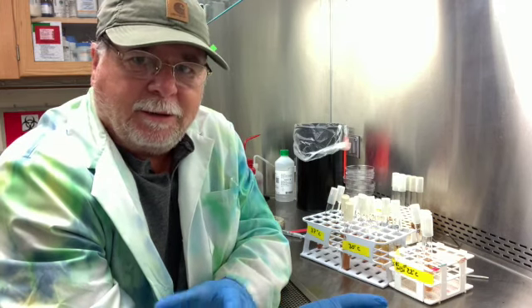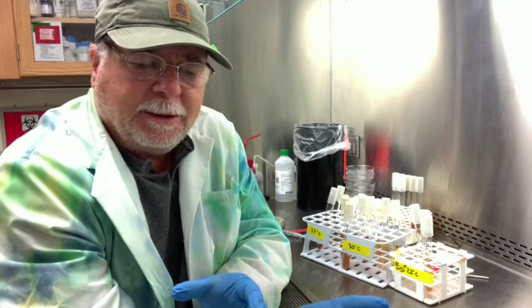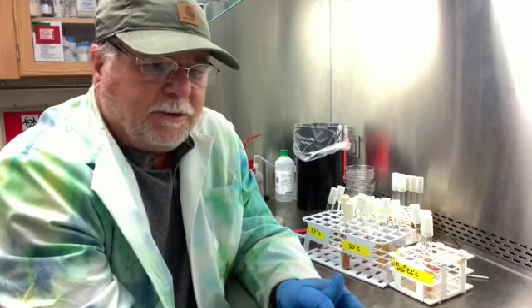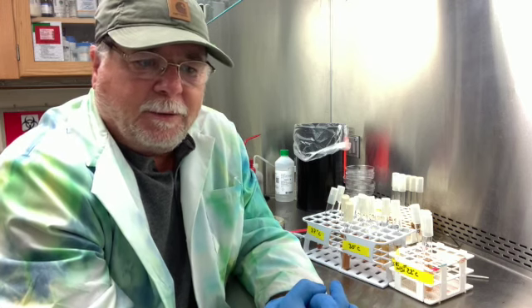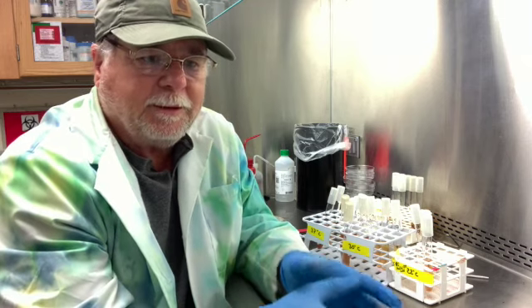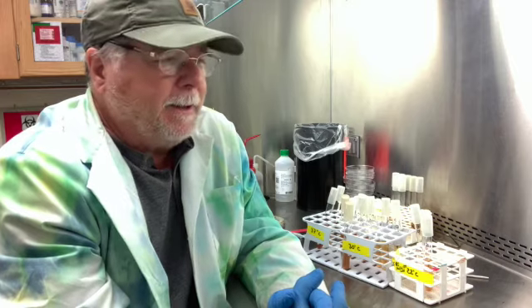If it's a really large one, it might have some flagella maybe, but it's not going to swim. So we're going to call it like we saw it, but just keep in mind you have to take this as a big picture mixed with your other results, and so it has to all point towards a specific bacteria before you can identify an unknown. All right, thank you.